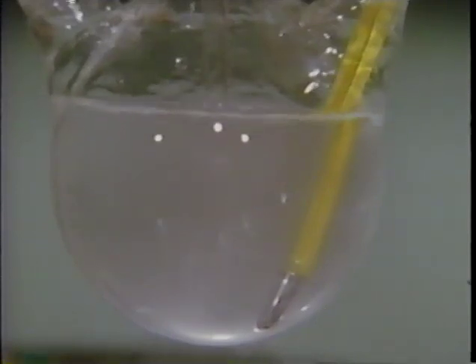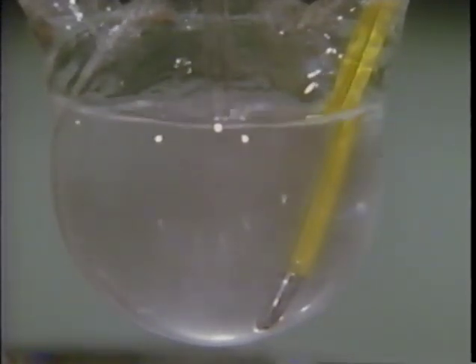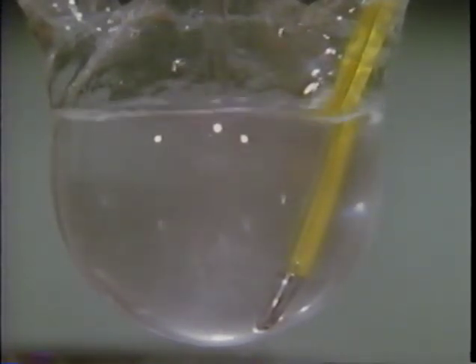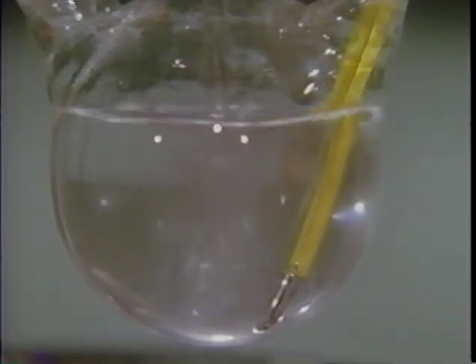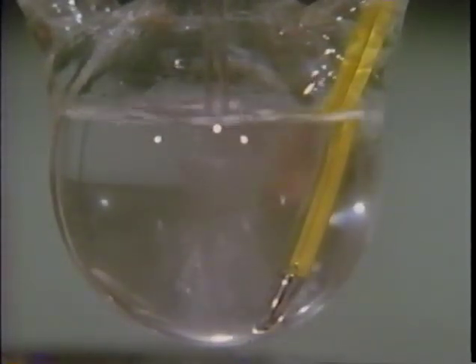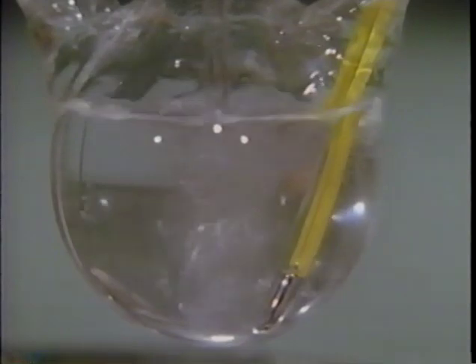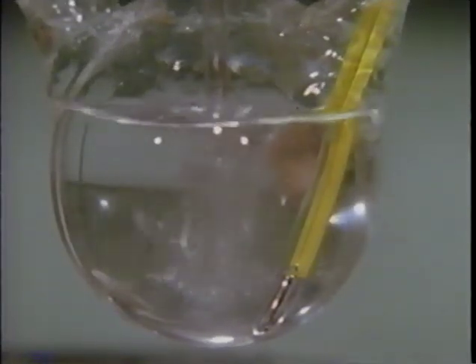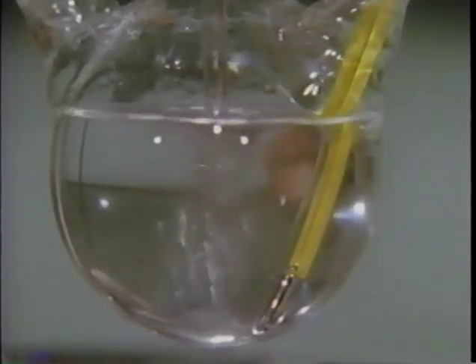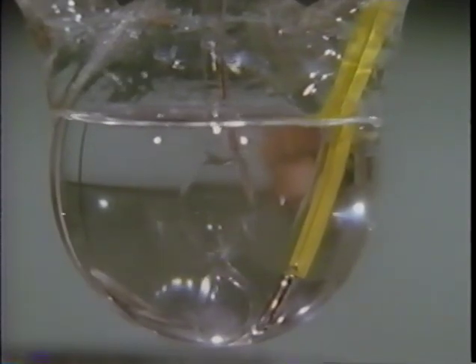After 3 minutes of reaction, the contents have begun to clear. The final clearing means that a homogeneous solution has been formed. The ester droplets have disappeared. The hydrolysis appears complete. Let's isolate the products from this solution.